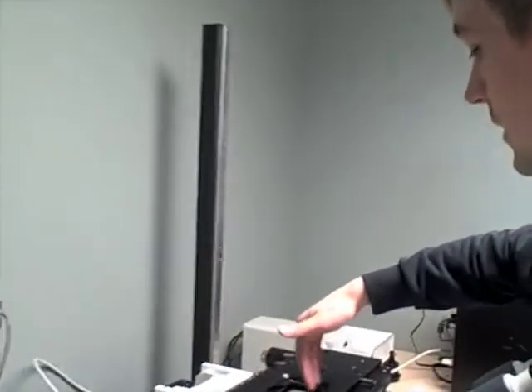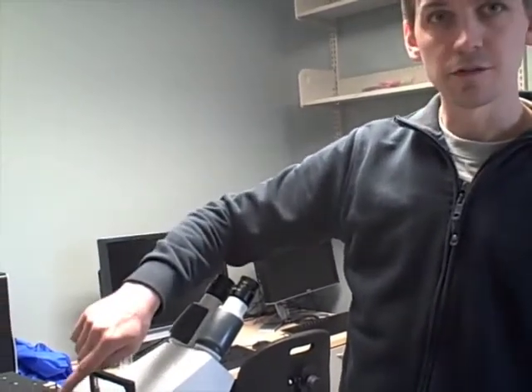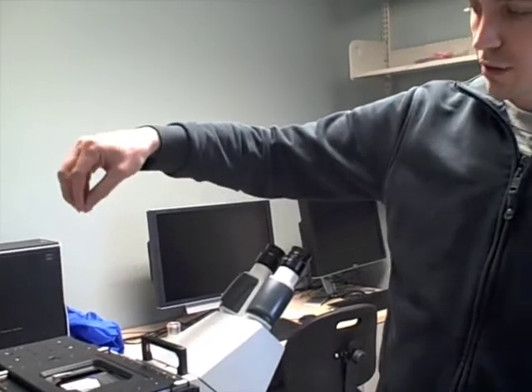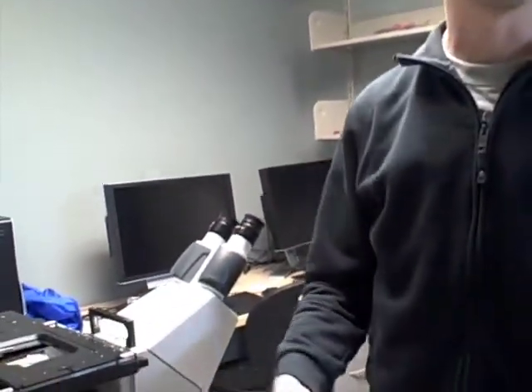These are the two that will be available for simultaneous imaging of two single molecule species. I was able to get a filter set that will allow both the 491 and the 561 laser to be reflected up towards the objective for TIRF, and then both the emission of a GFP and, let's say, an mCherry or RFP fluorophore to come down to the beam splitting device to the camera at the same time. So that's the fanciest experiment.